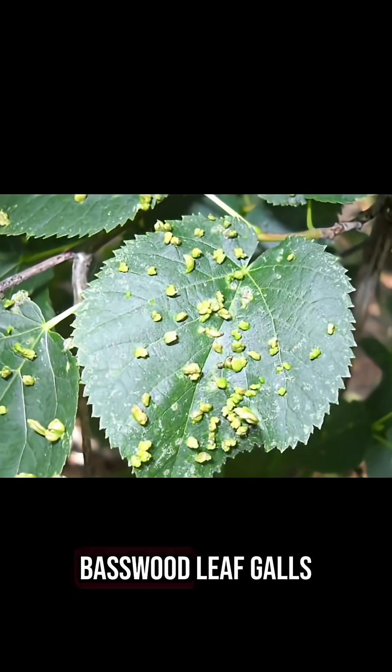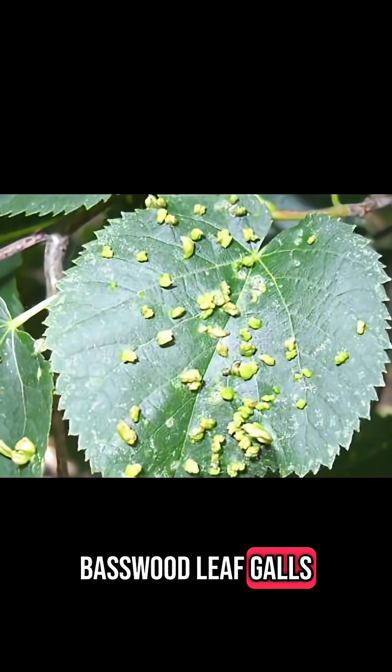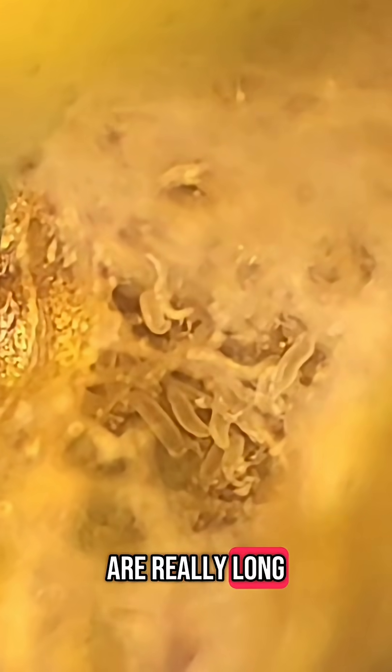Let's try these basswood leaf galls. Hey, more mites. These are also eriophyids, but these guys are really long. They almost look like worms, but they're not.